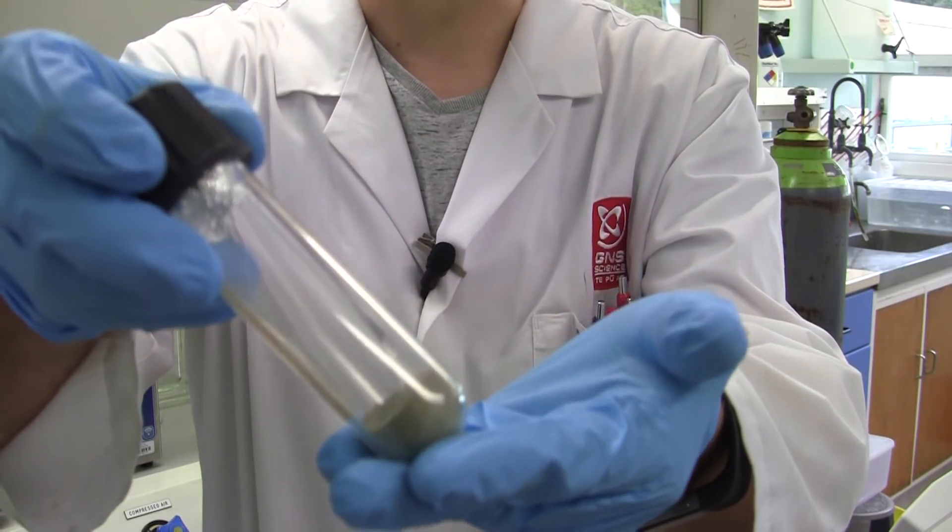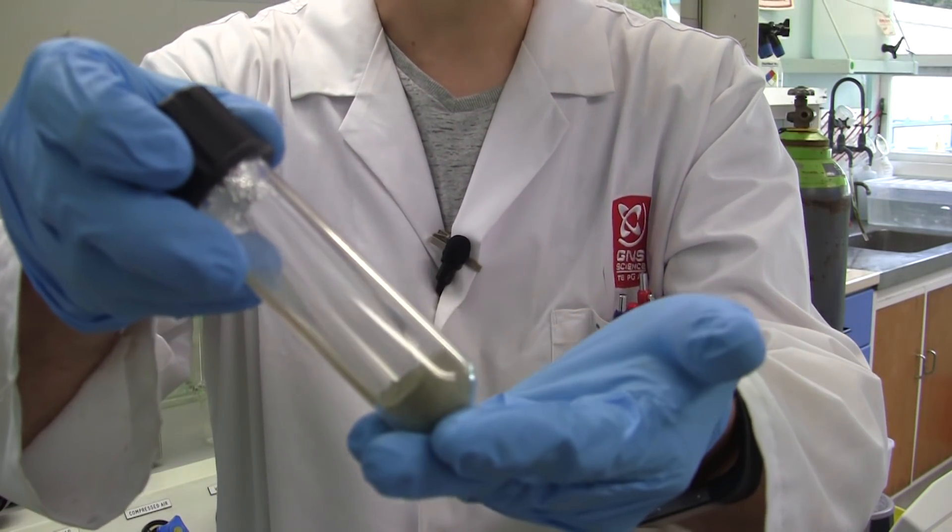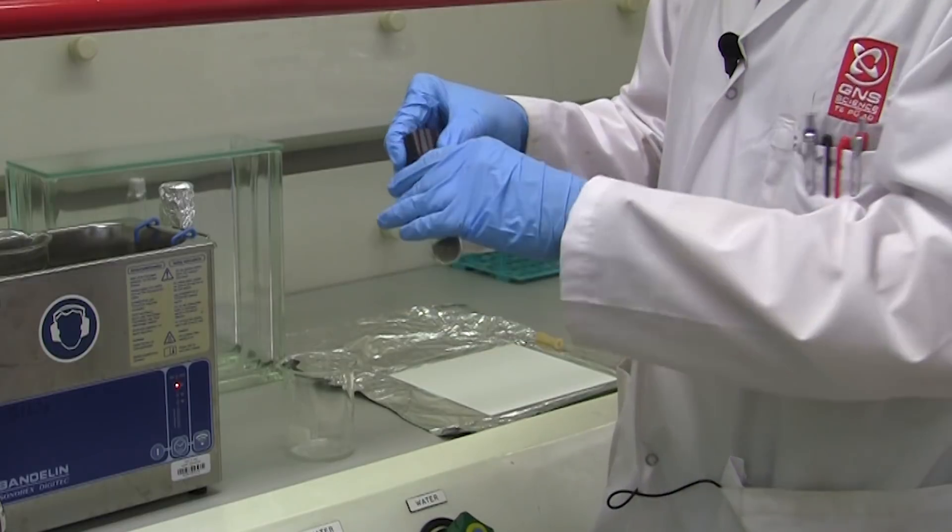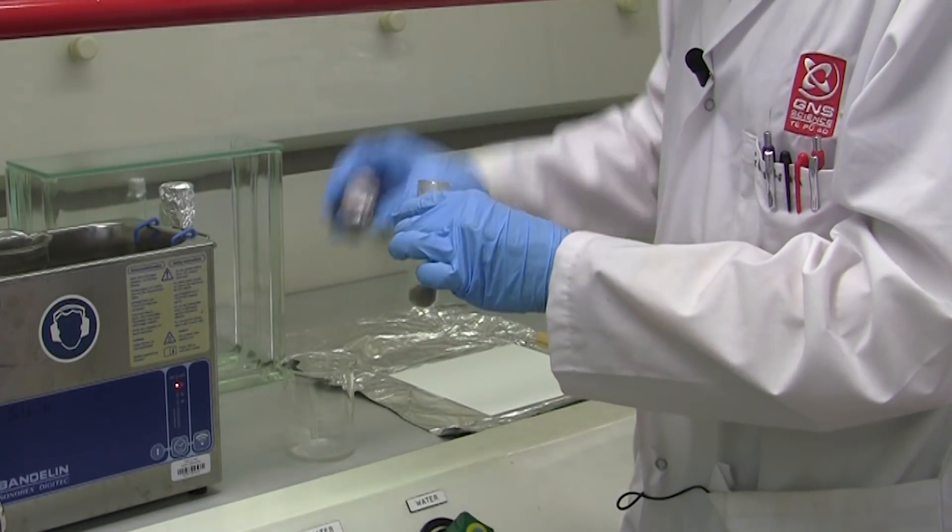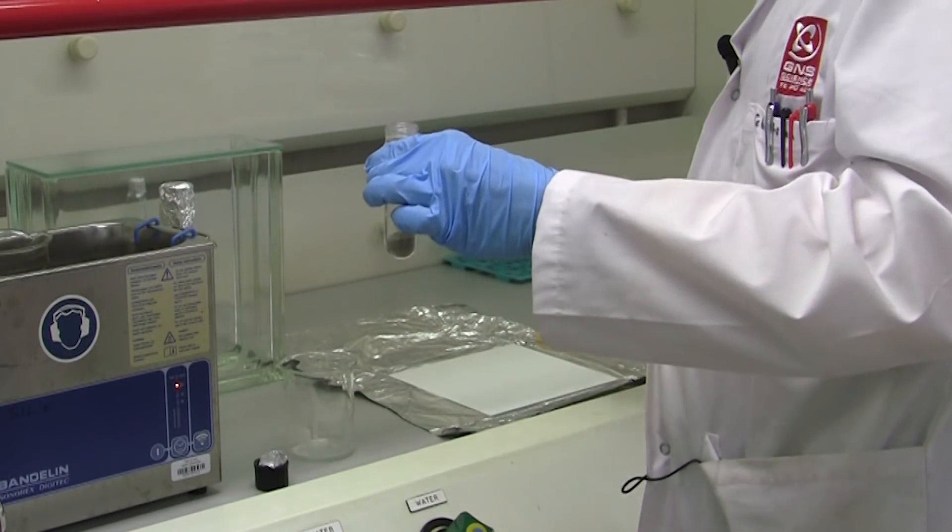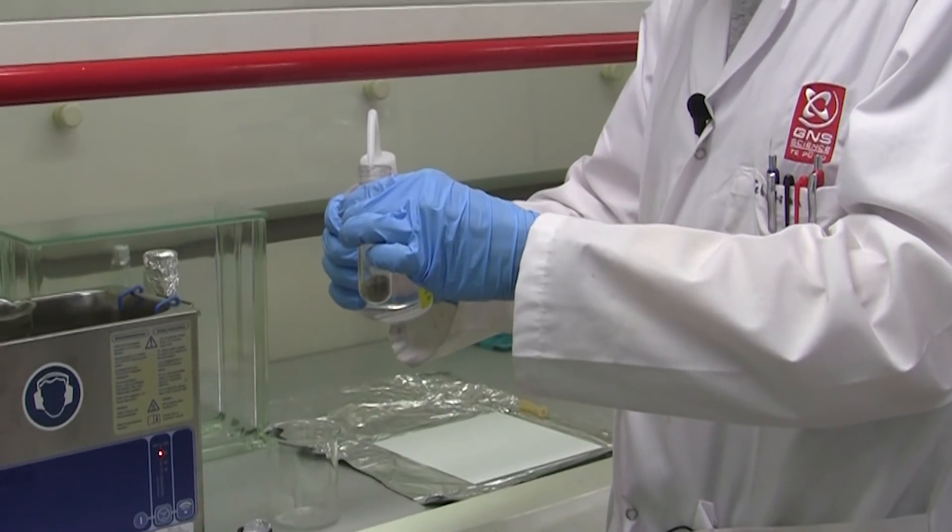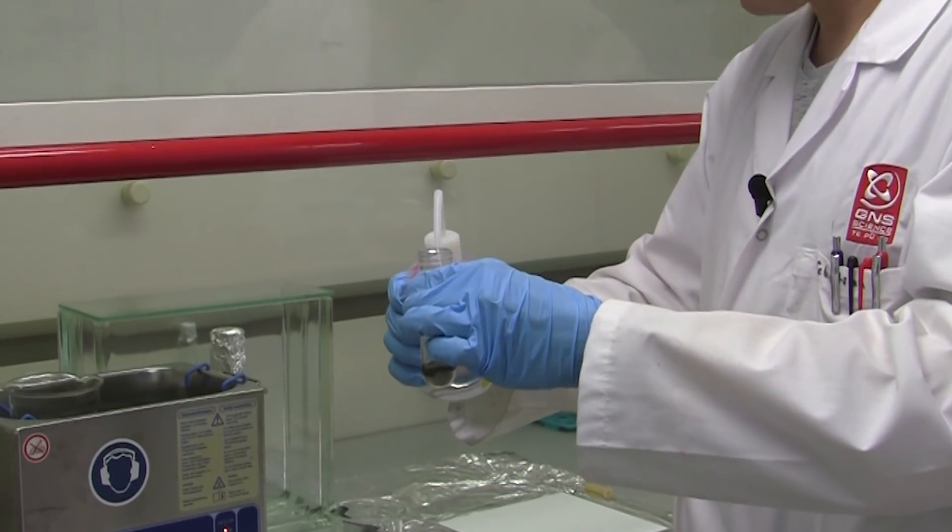In this mud sample there are pigments from organisms that live in the lake, and so we can use this to isolate our pigments. We need to use organic solvents to get all the pigments, all our compounds, into solution.